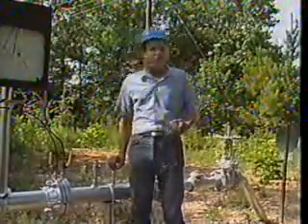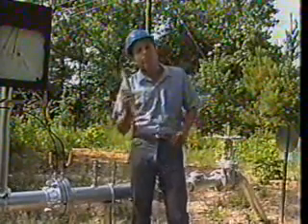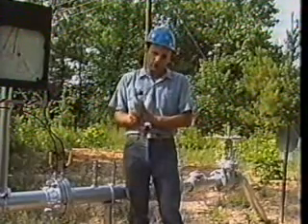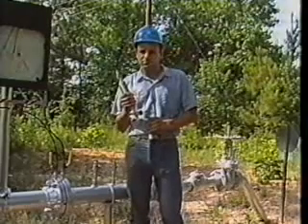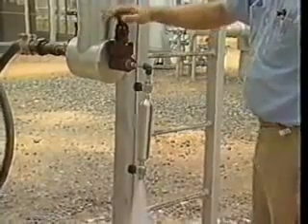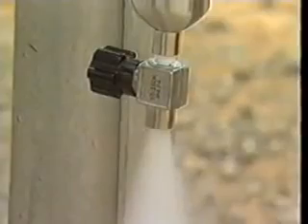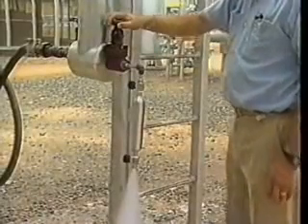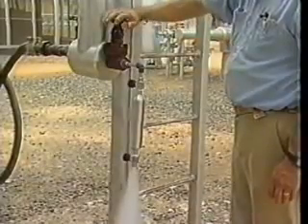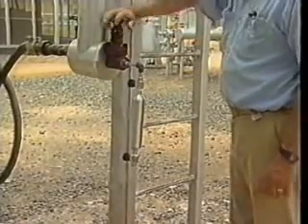Samples are collected in a device called a sample cylinder, like this one. Care should be taken to have a cylinder that is of a proper working pressure and made of a material that will not react with the sample. This is usually stainless steel. The sample cylinder also must be cleaned properly with a solvent such as acetone or trichloroethane, then steam cleaned and air dried. If a sample cylinder has not been cleaned properly, oil, grease, or other contaminants in the cylinder may absorb some of the heavy hydrocarbons in the sample, resulting in an inaccurate sample.